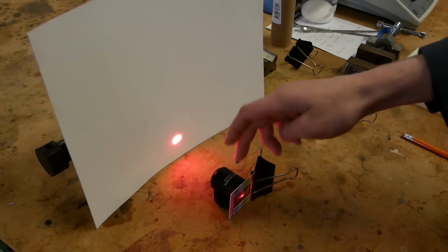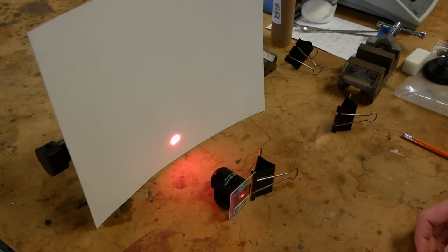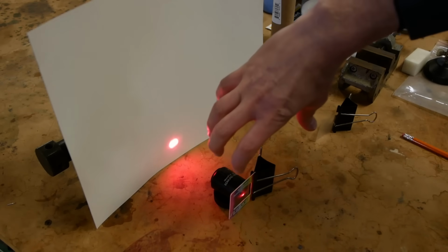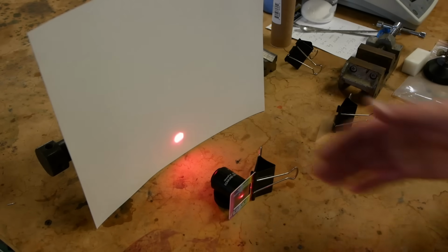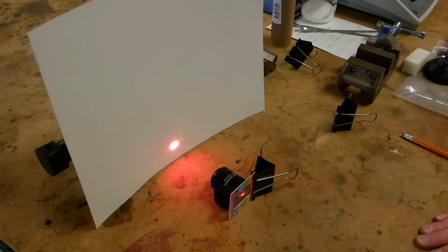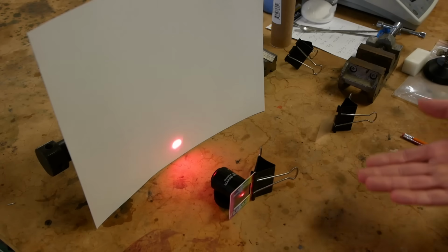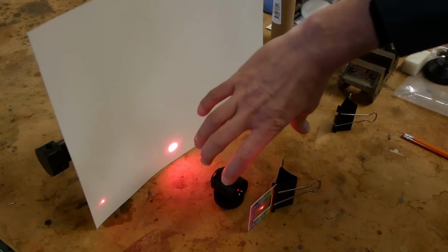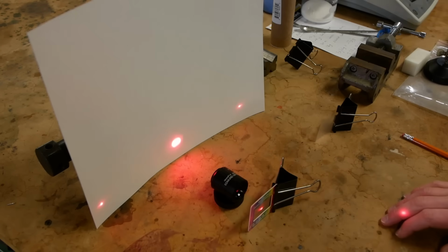In other words, if the lens had a higher numerical aperture, then the resolution limit would be higher, because it can accept more of these highly diffracted beams of light into the optical system to get focused down to make the image. Pretty cool, right? That's the fundamental basis for a diffraction limit. Diffraction limited optics, meaning how much of a diffraction pattern it can accept to get higher resolution.